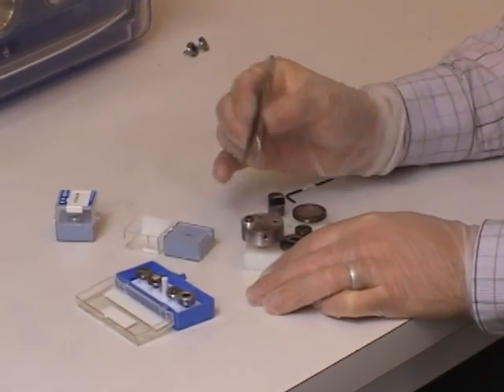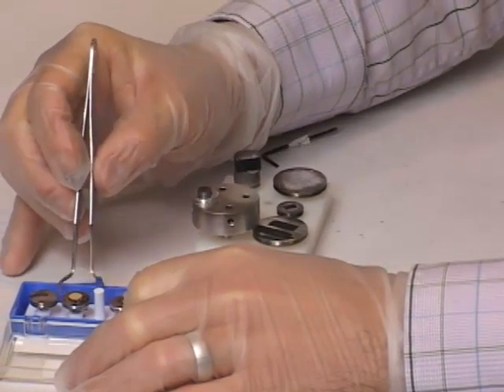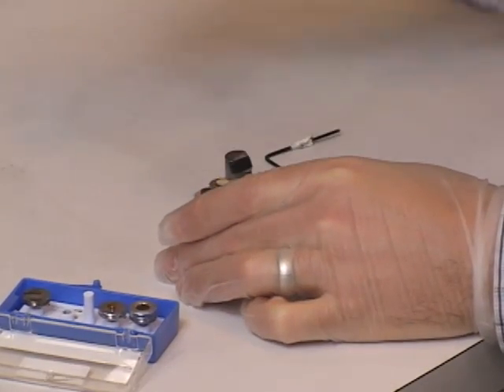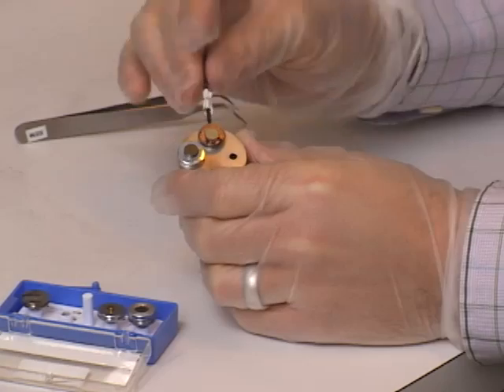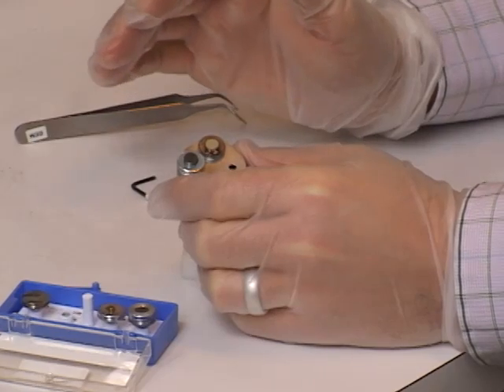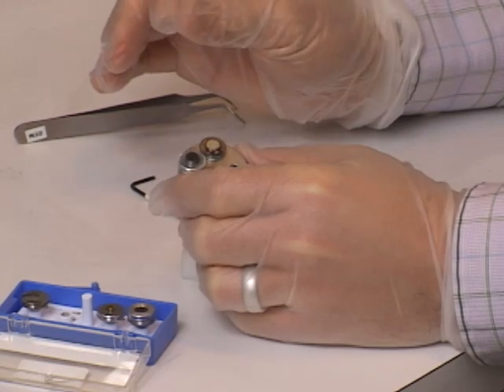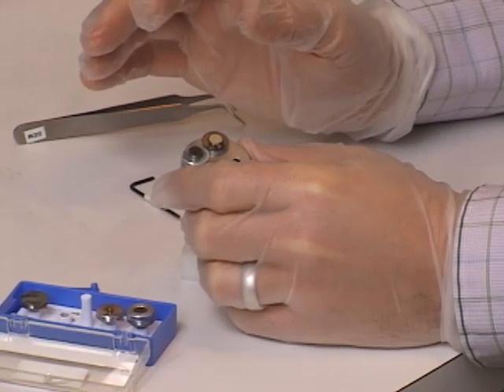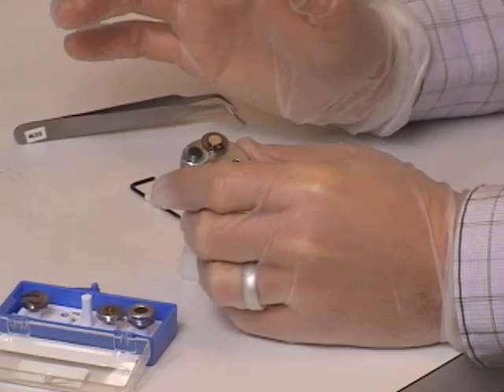I'm placing the gold nanoparticles in the top position and tin spheres to the right. When mounting the sample holder, I always put samples in the same orientation so that once it's loaded and I'm imaging, I can remember where everything is located. It's a good habit to place things in the same position each time so you don't get lost — when samples are in the chamber and you only see a small area of view, it can be disorienting and it may take time to find samples.